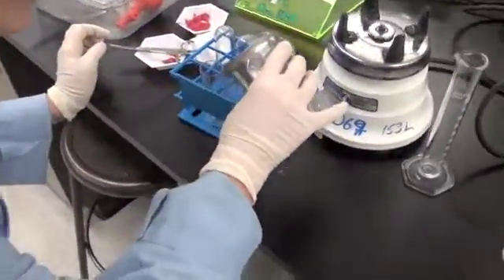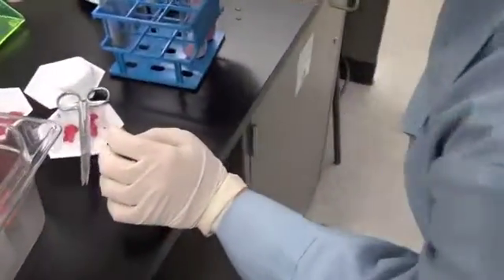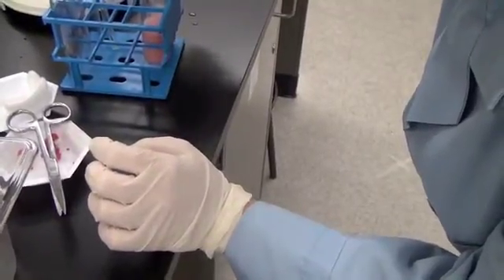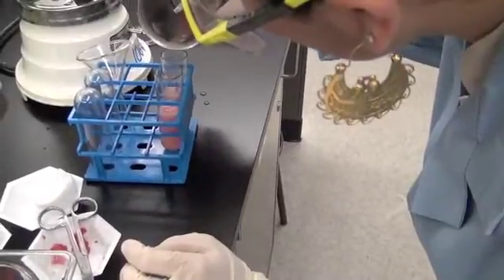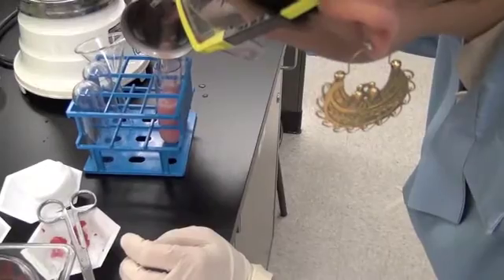Dr. Beckman, why is she pouring her samples into two non-disposable centrifuge tubes? She's doing that because at least she knows that she cannot spin the complete volume in these centrifuge tubes, as it will spill out if they were full during the spin. Also, she has to balance each tube during the spin so as not to damage the centrifuge.